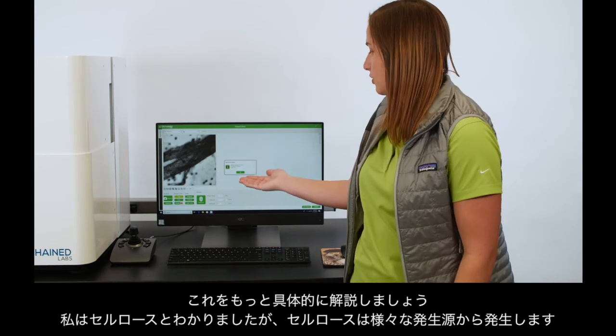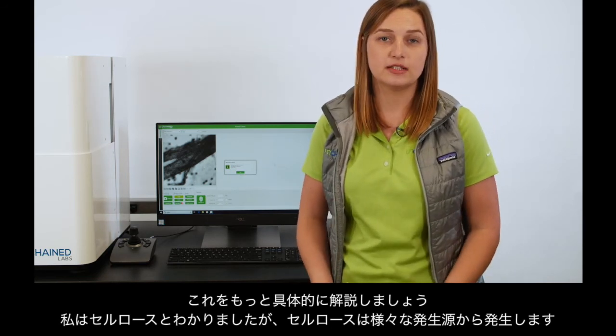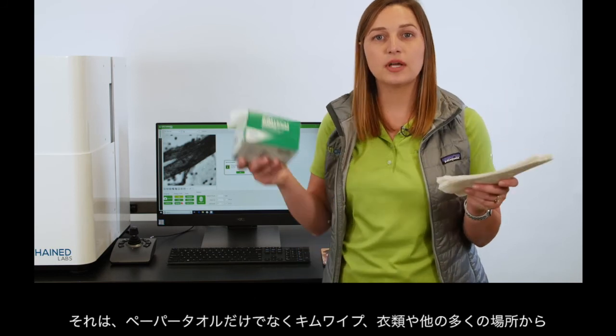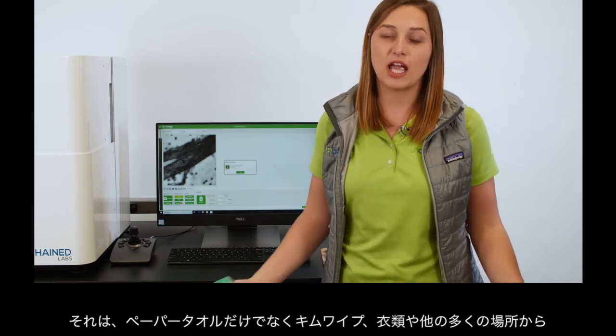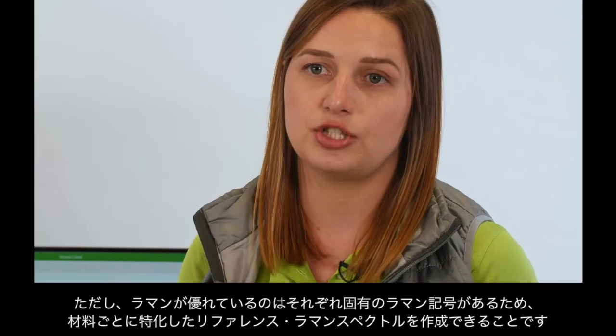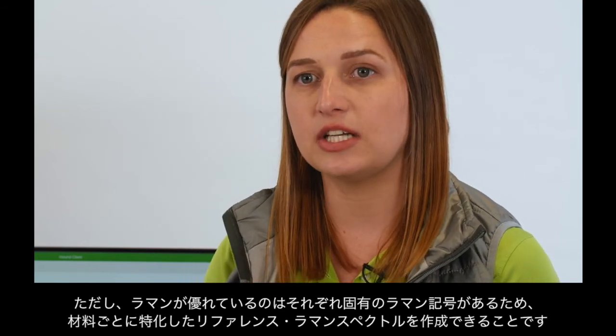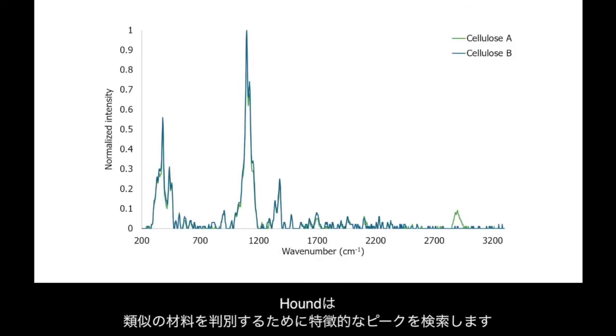We just found a cellulose particle, but cellulose can come from a variety of sources. Not just paper towels, but Kim wipes, clothing, and many other places. What's cool though is that each of these has a unique Raman signature, so I can generate a reference spectra for each material. Hound searches for unique peaks to distinguish similar materials.